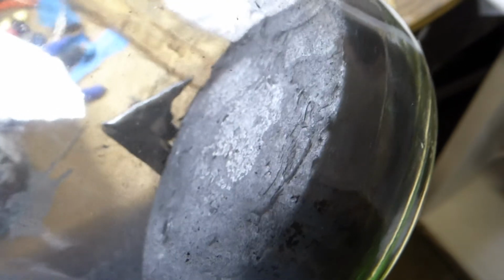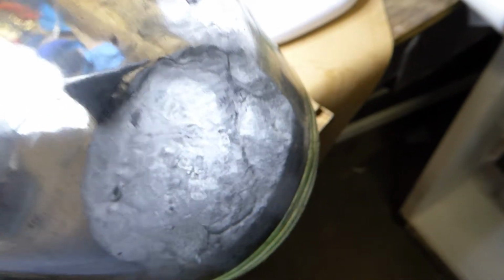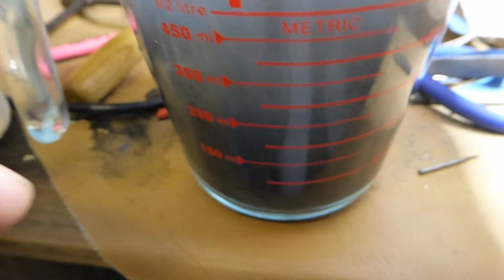So I put some high voltage across the ends of the stringer, and then lo and behold, the product had conductivity. So that's where this whole let's make some decent product to experiment with is going.